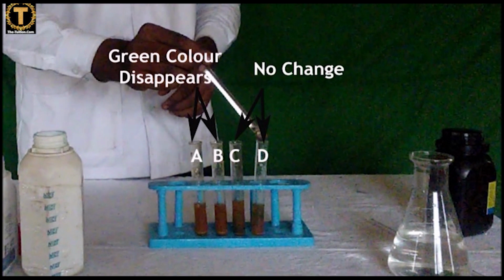In test tube A, the green solution becomes colorless. B is also the same, with the green solution turning colorless. And in C, there is no change. And in D, also there is no change.